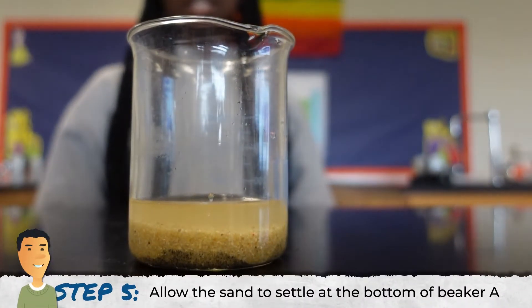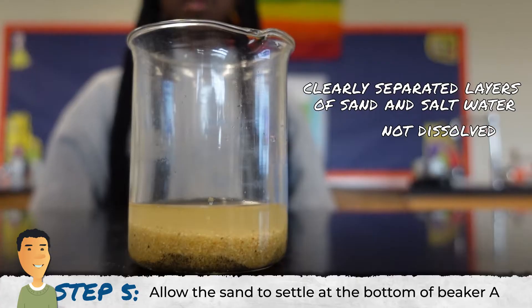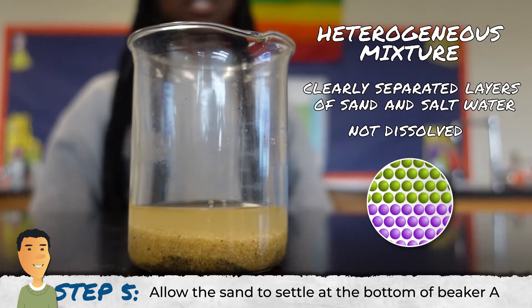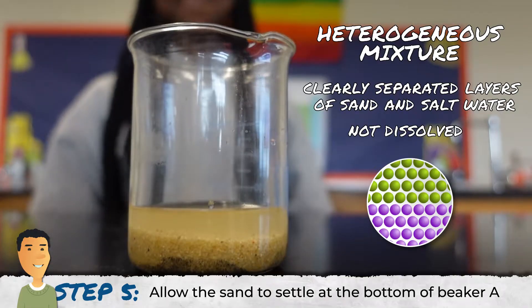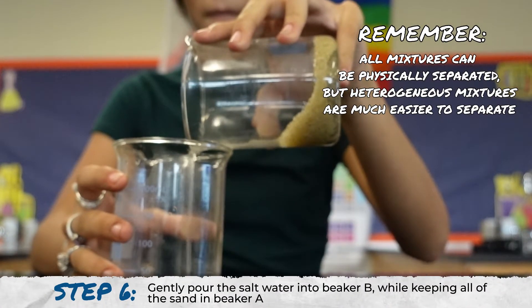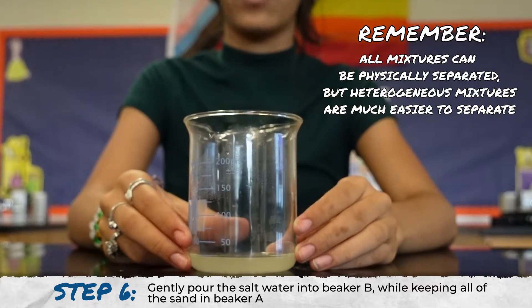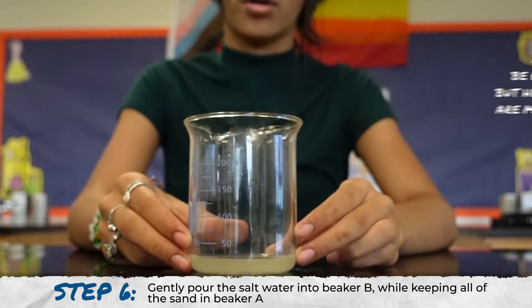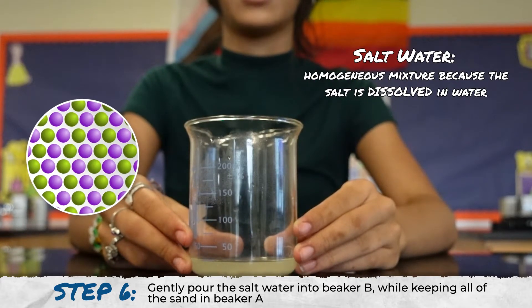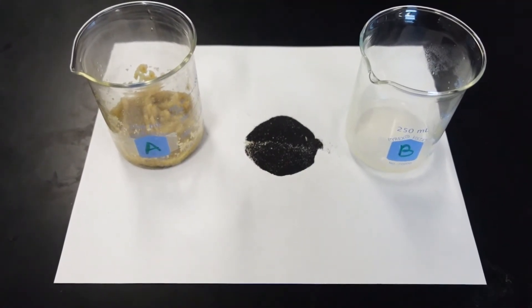The salt is dissolved inside the warm water while the sand is settled at the bottom of the beaker. This is another clear example of a heterogeneous mixture. Now we'll take the sand out of the mixture by pouring the salt water back into Beaker B. Since the sand has been removed, we're left with salt water, which is a homogeneous mixture because the salt is dissolved in the water.